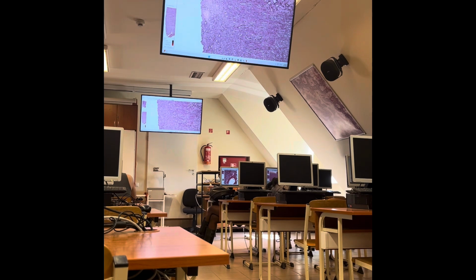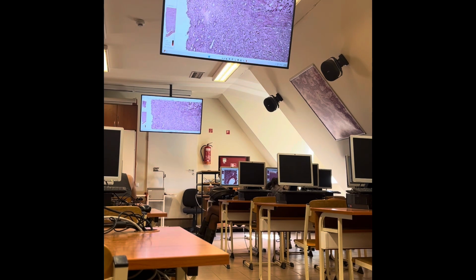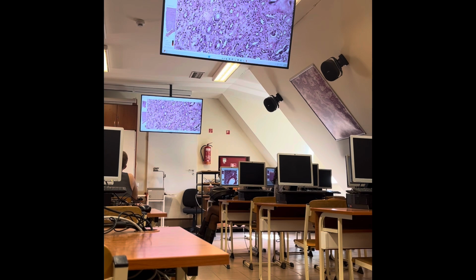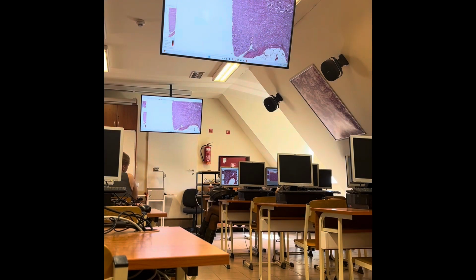In the deeper part, there are capillaries, and these capillaries are important in the formation of the final composition of the urine. There is an exchange system here between the loop of Henle and the capillaries. This is also called a countercurrent multiplier system. You will learn the physiology of this next year in the physiology subject. So the capillaries and the thin segments of the loop of Henle we can also see.